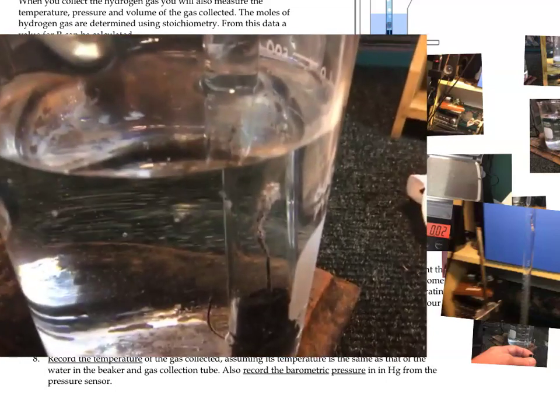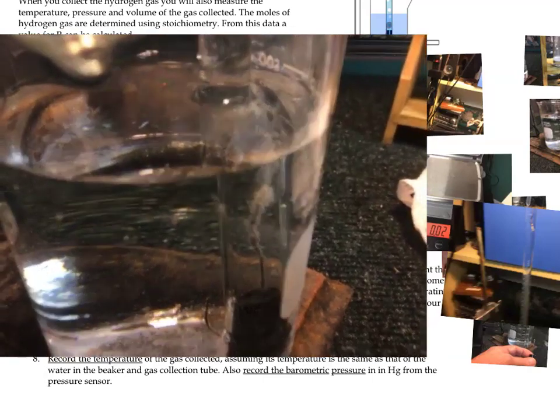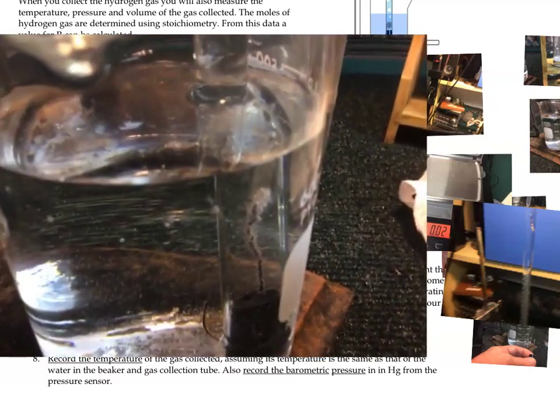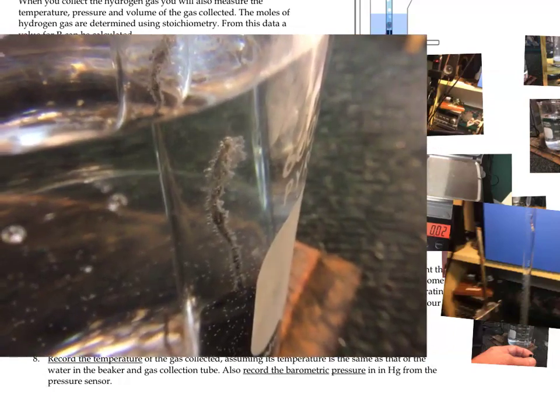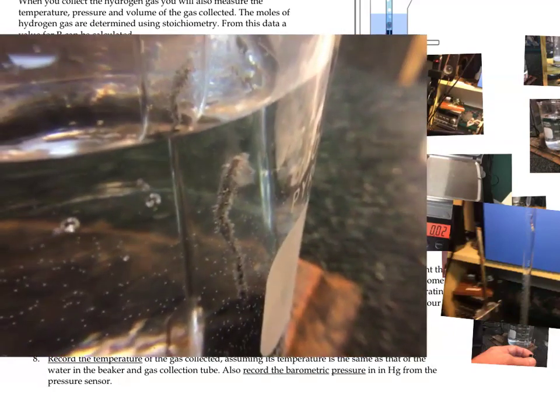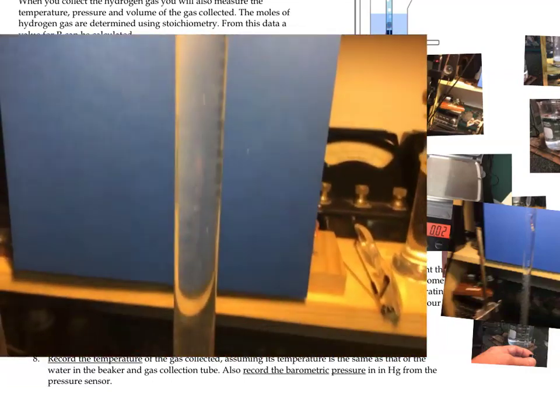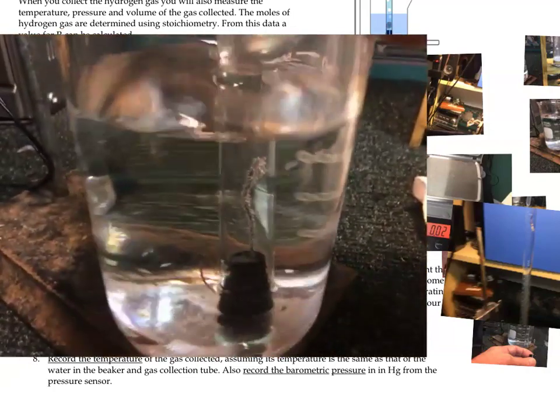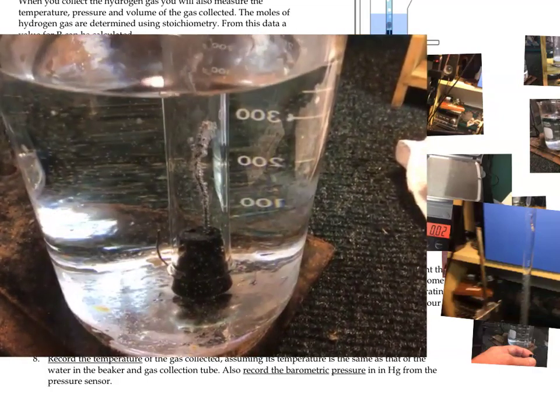As the acid comes down, it will start to react with the magnesium, creating hydrogen gas. Let's see if we can zoom in on this a little bit better here. There it is. You can see the bubbles forming of hydrogen. They are now making their way to the top, collecting at the top of the eudiometer. All right, this will take us a little while. So we're going to let it sit and react for however long it takes until all the magnesium is gone.